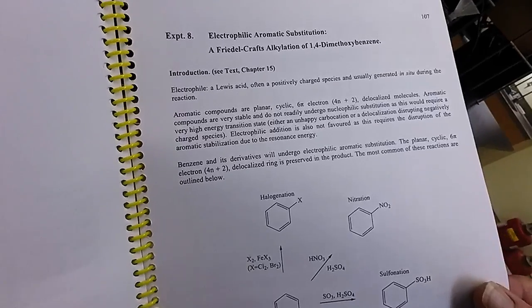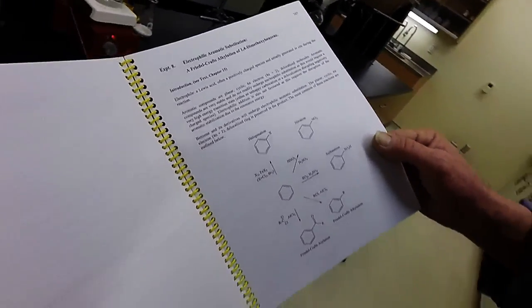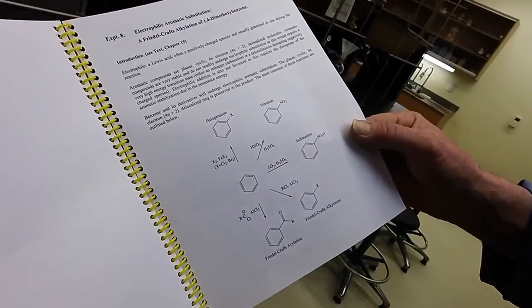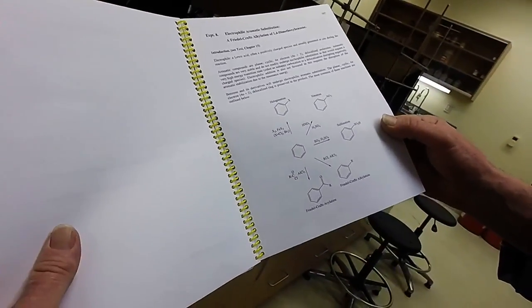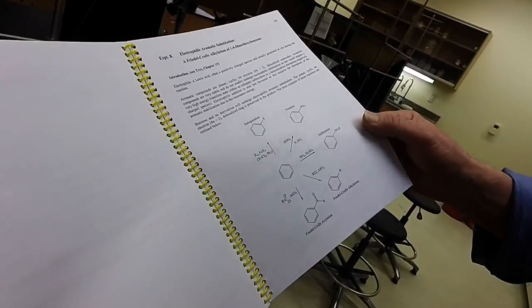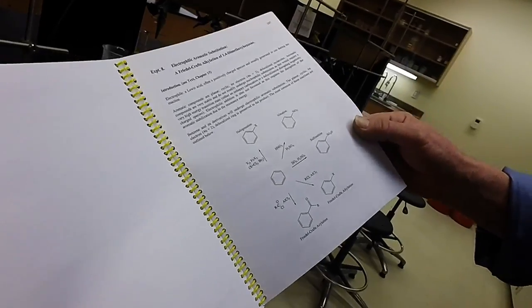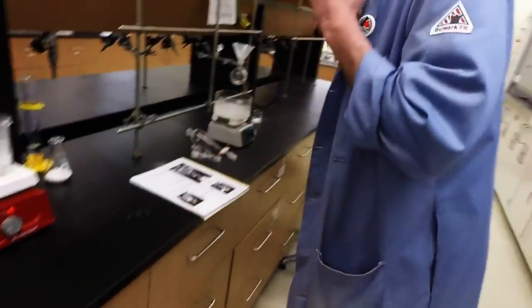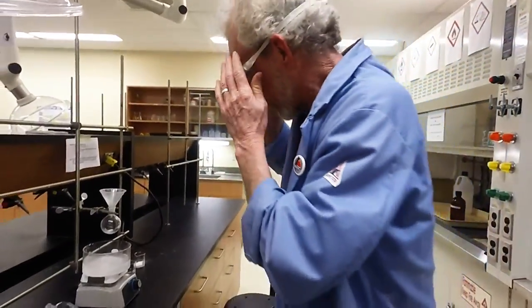Okay, welcome back to the 2700 lab. This time it's electrophilic aromatic substitution. Lots of examples here for you, take a look at them. You probably need to know these reactions for your final exam. Still, what we're doing today, here we go. Put the goggles on.